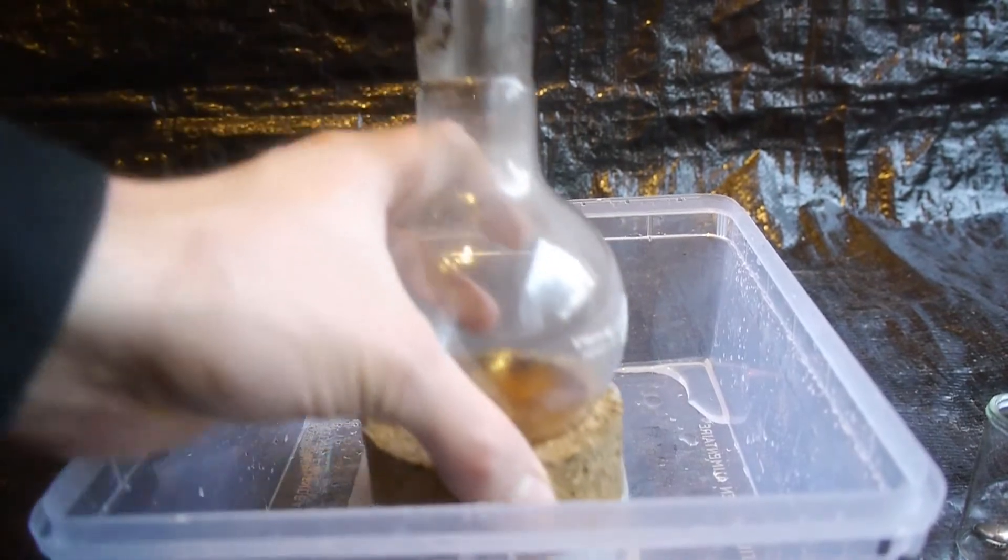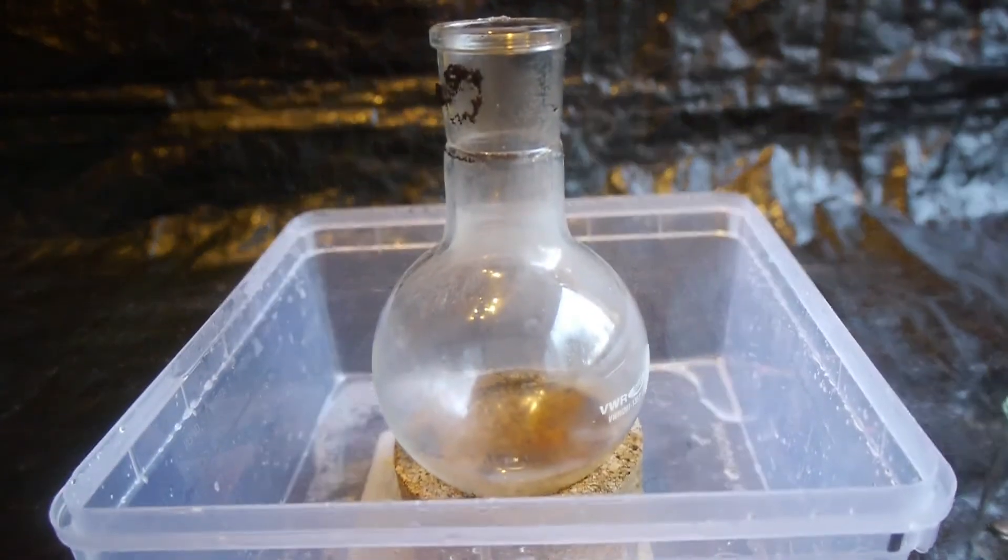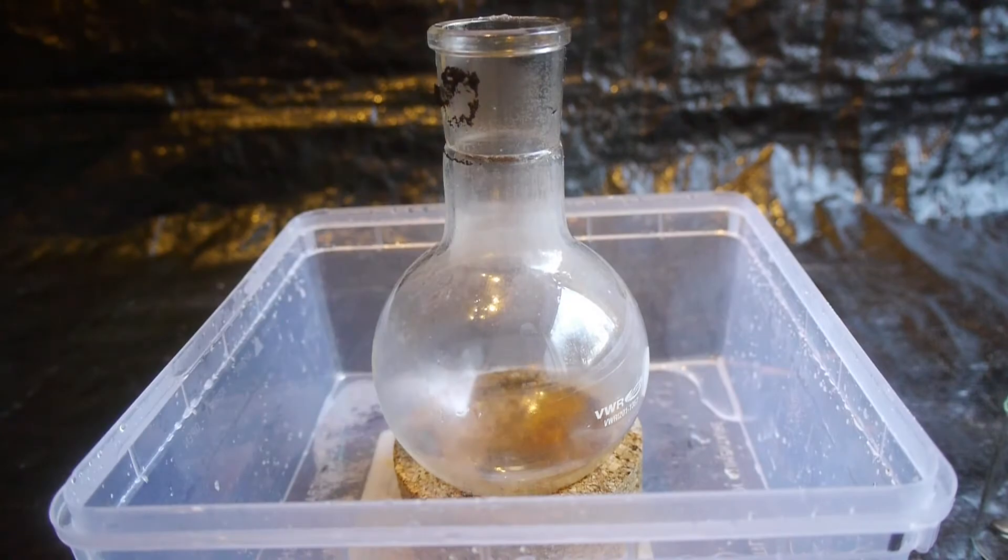And now I can filter the other mercury directly back into the distillation flask.